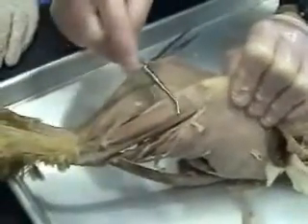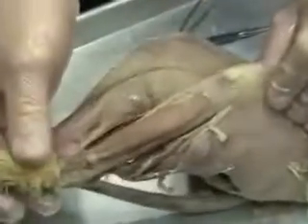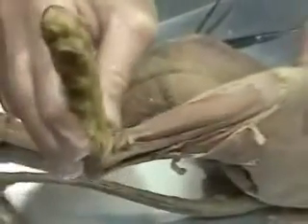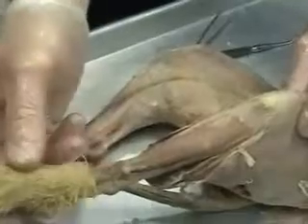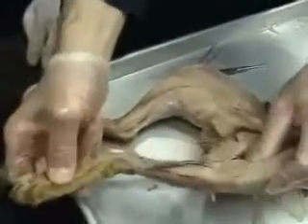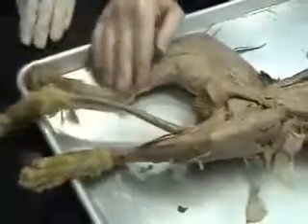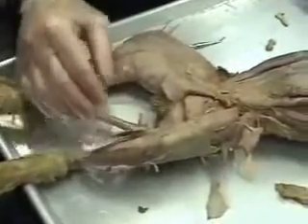Also in the lower part of the leg on the anterior side is the tibialis anterior, right on the front side of the lower leg, and that has two actions: it dorsiflexes the foot, and it inverts — it turns the sole of the foot medially, rotates it medially. That's called inversion. The other muscles of the leg are best seen from the back side.